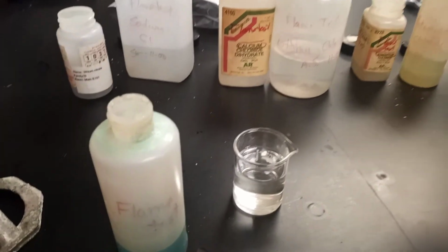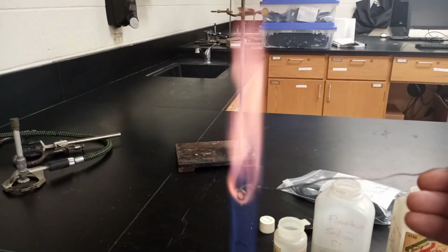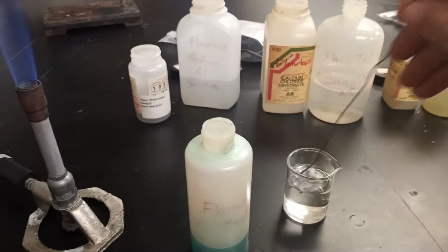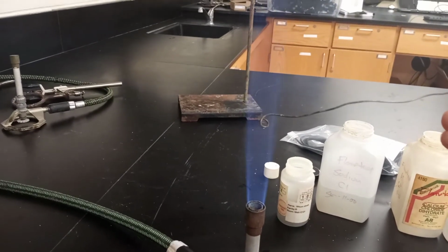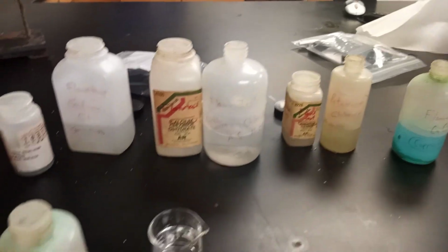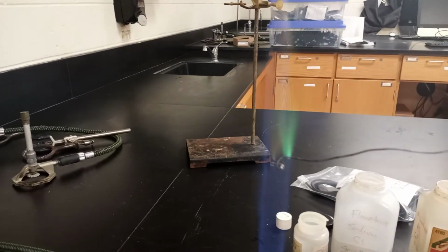We're going to go with this one, which is potassium. All right, get the potassium in here. And there we go. Got kind of a purplish hue with this one. Wash it off and dry it. You'll find that there's certain parts of the Bunsen burner that are hotter or colder. Anyways, this lab stuff is more of a writing exercise. So it's not about getting the answer as quick as possible. It's about completing your lab requirement of writing.